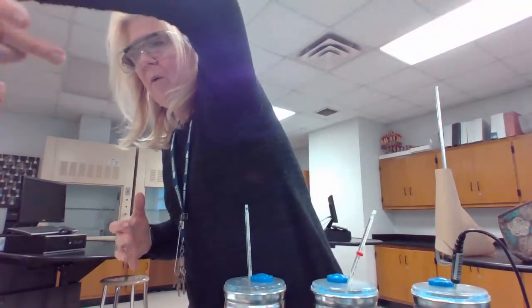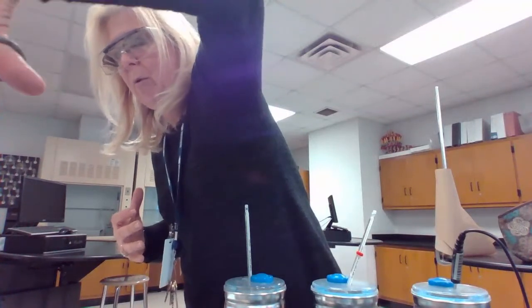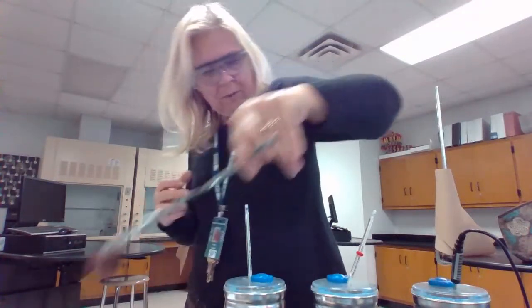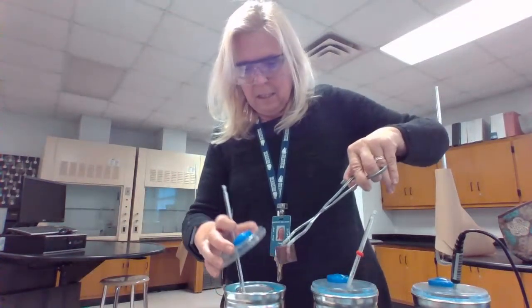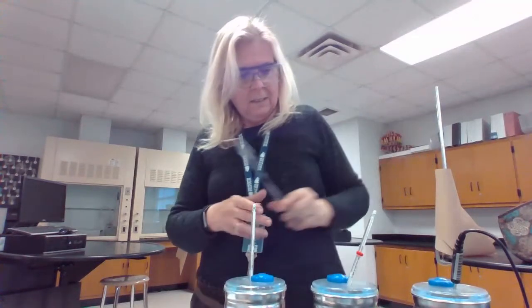And I've just found out that one of my thermometers is broken, so I'm going to use the temperature probe for that thermometer. So that was my aluminum thermometer. I'm having to switch over to a temperature probe, and I'm moving copper, which the starting temperature for the copper was 98.2.